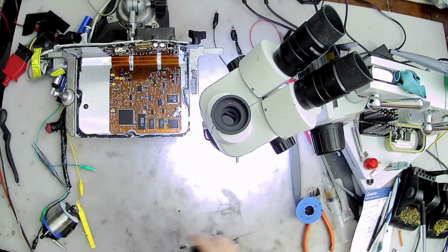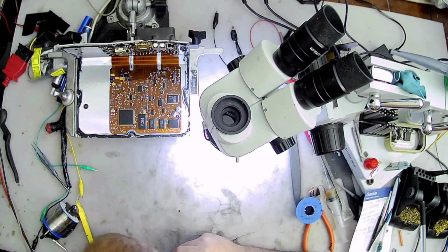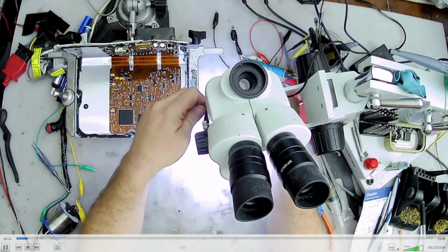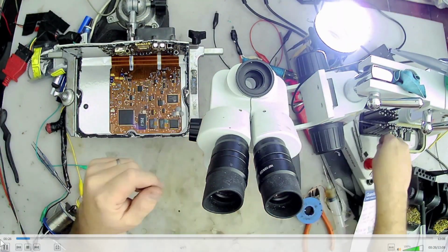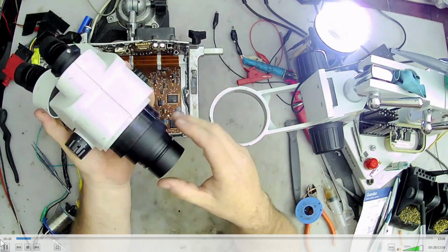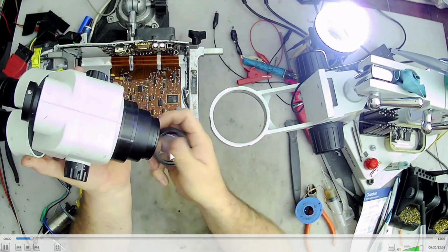So I'm gonna go through this video, show you guys how I took it apart. It was actually pretty simple. So first thing you want to do is get your lenses off of there. So I'm gonna take my nice lens off.